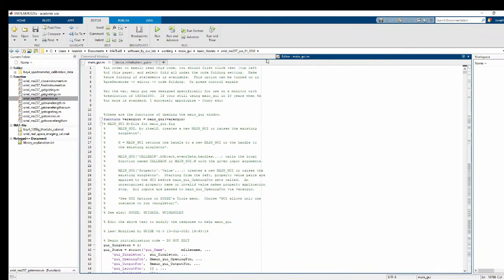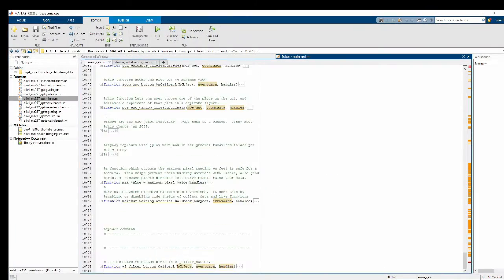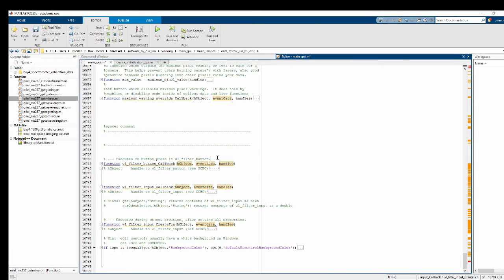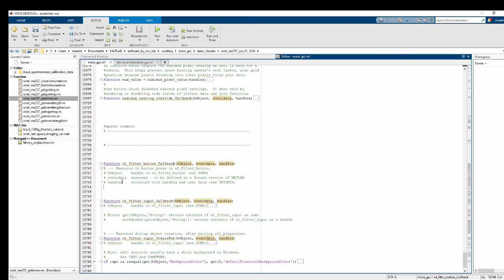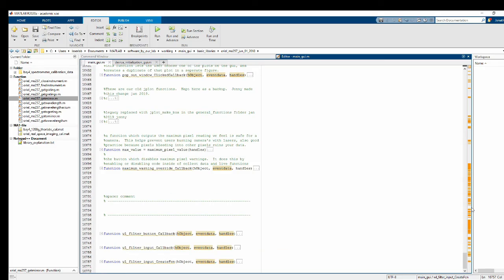It'll pop open main GUI with these new functions that it added in for us. And now what we have to do is go all the way to the bottom underneath my filler comment. And I'm going to do the same thing where I get rid of these extra comments that I don't really care for. Add in an end statement, and another end statement. Now if I hit Control plus, everything should compress down. Okay, it looks good.